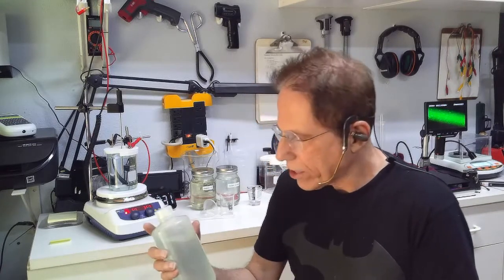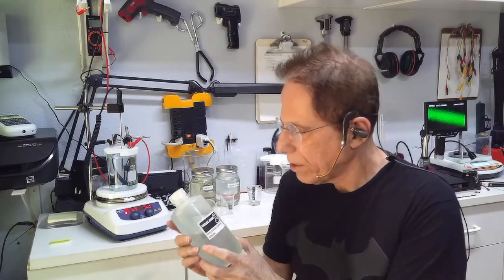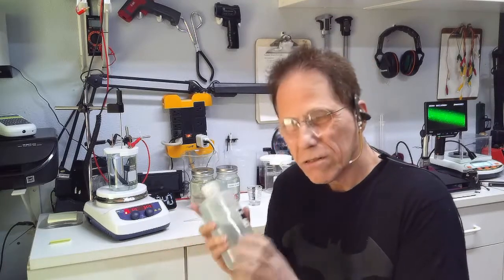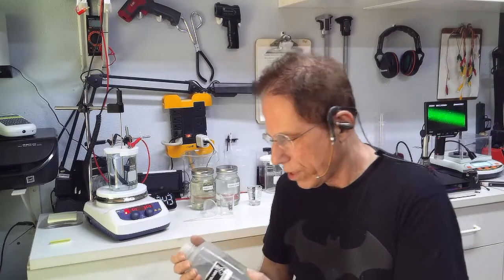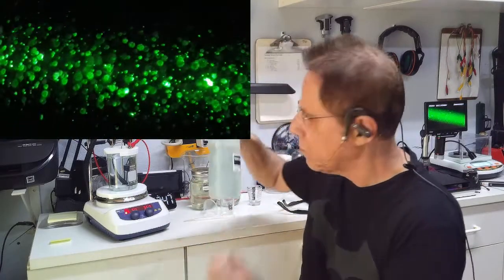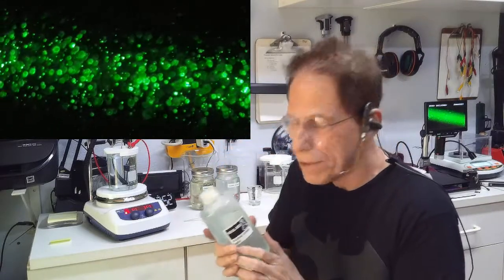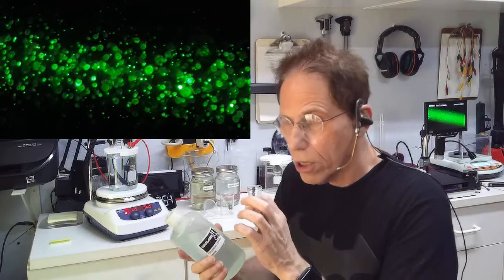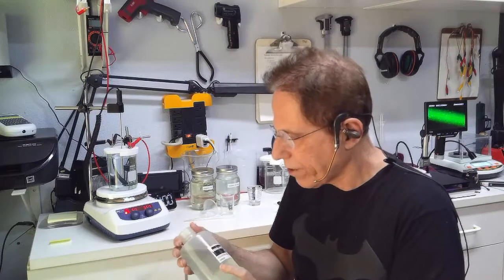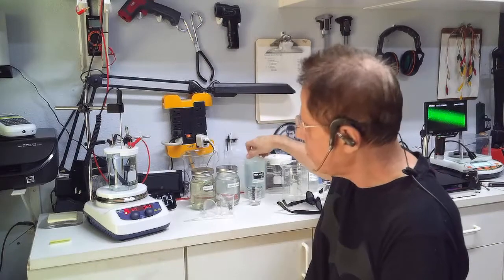So like this batch, which started out a really nice, healthy color green, has now aggregated to this light color green. It still has stuff going on under the video microscope, but it's lost a lot of what I consider properties, where you have a lot of large particles, medium particles, and small particles. So it's kind of aggregating to mostly large particles and not so much small particles anymore.